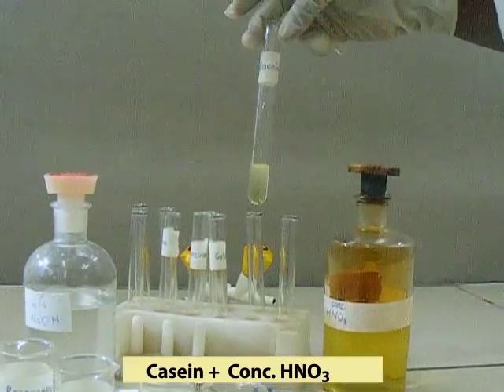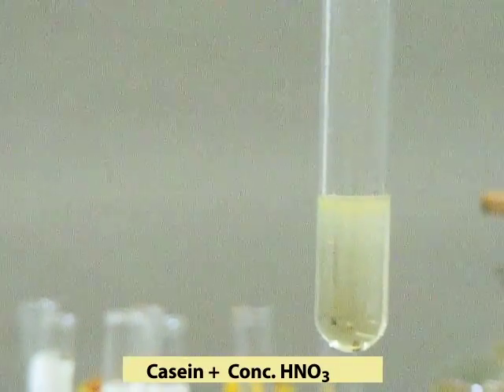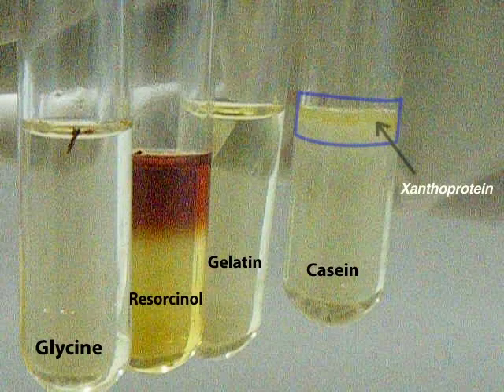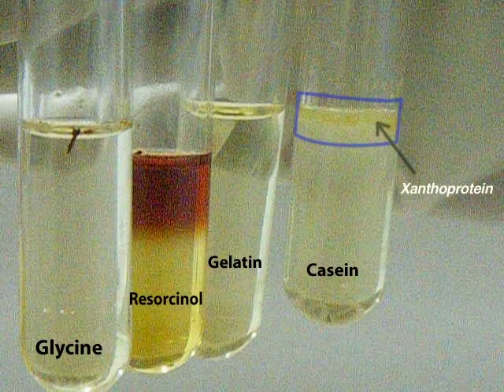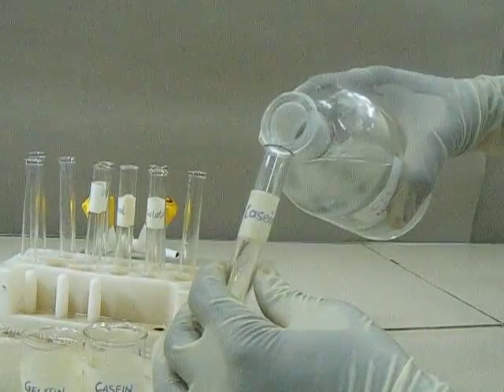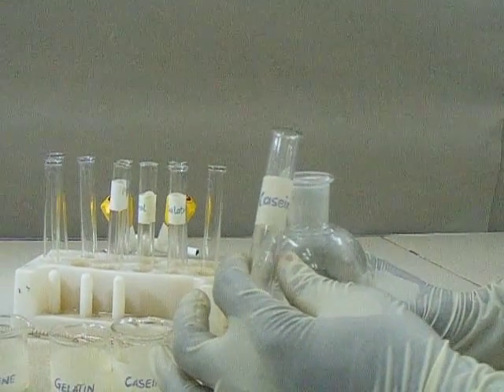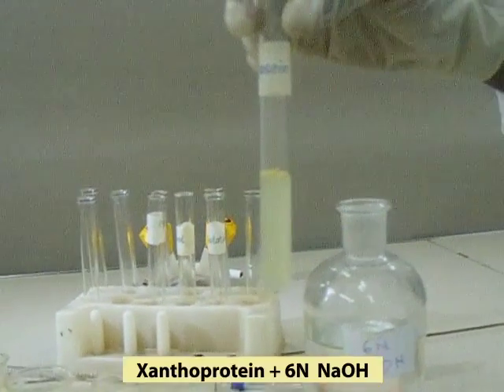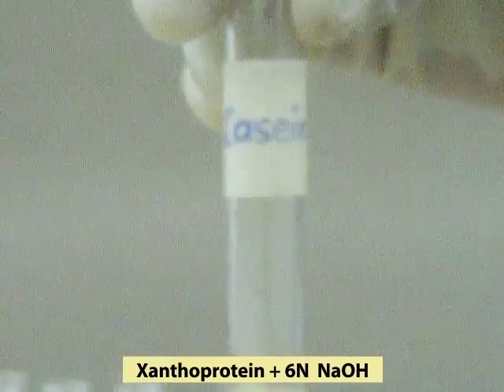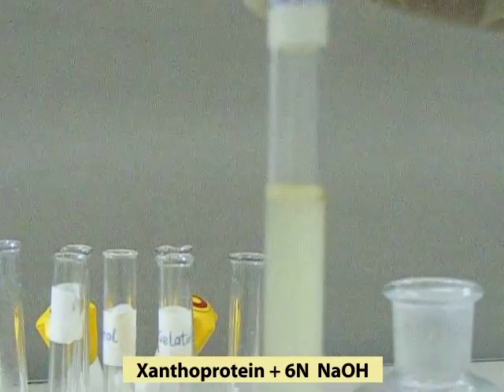Observe for a yellow substituted product, which is the xanthoprotein. Add 6-normal sodium hydroxide and observe for the formation of an intensely colored yellow product, signifying the presence of amino acids with a phenyl or indole group.